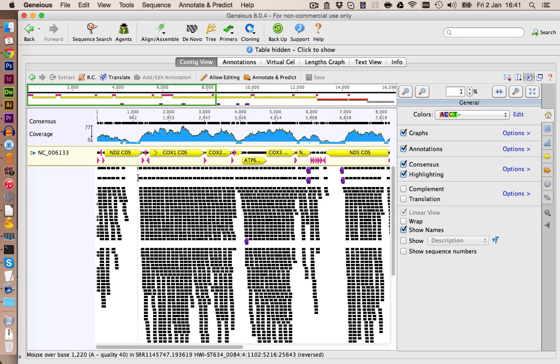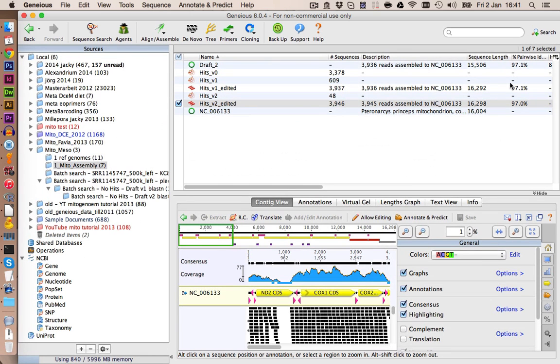BLAST might not be able to extend those regions here because the overhang is not big enough, or actually it might be a region where we have low coverage. So to test this, we used all the time the left set of sequences, and now let's try and use the right sequences, so the 500,000 sequences from the right side of the paired end reads, and we're going to blast those against our initial reference database, which included all the different mitochondrial genomes of Plecoptera which are available.